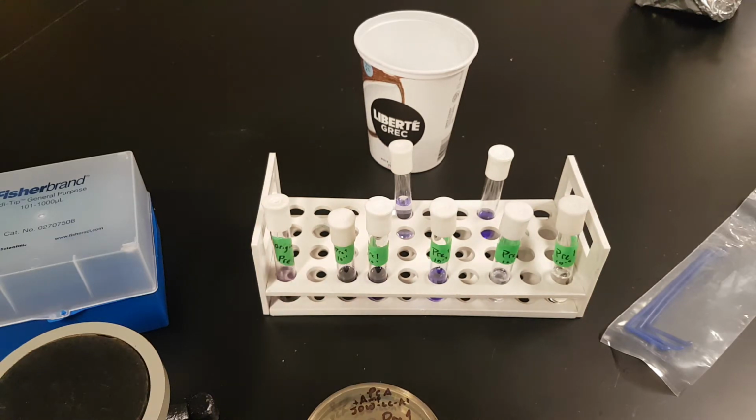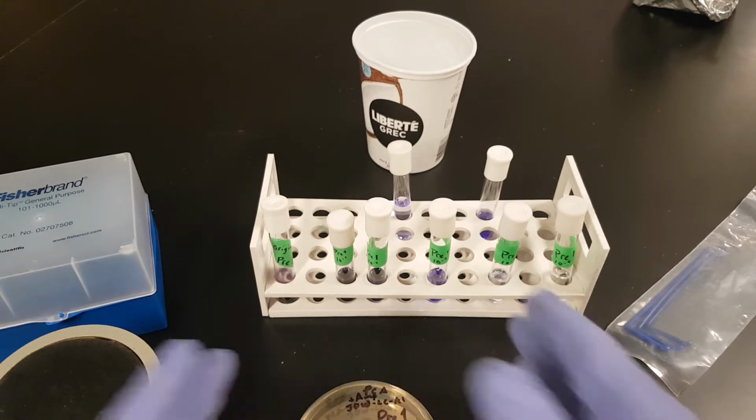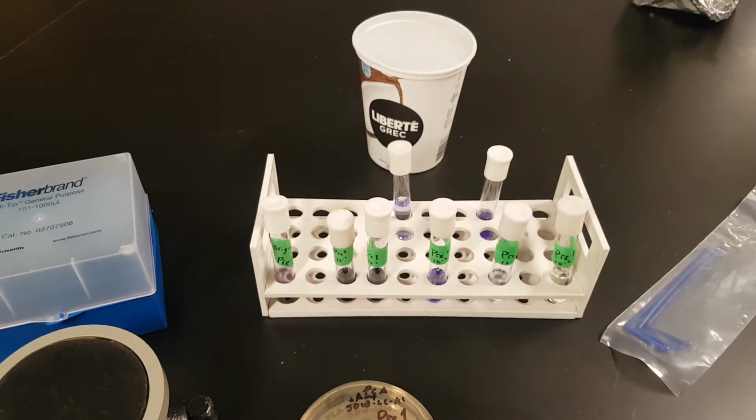And in this scenario, we suspect, or you suspect, that the pathogenic bacteria that you're working with or that is in the water might be ampicillin resistant. The reason you suspect this is because the people are not responding to treatment with regular antibiotics. Now, typically this is not exactly how this scenario would go because we're talking about a toxin that's made by the bacteria instead of an infection.